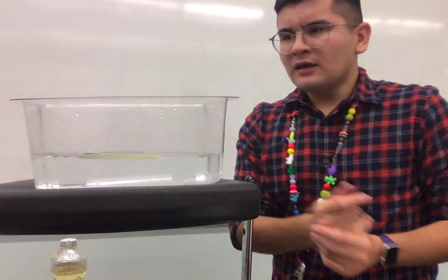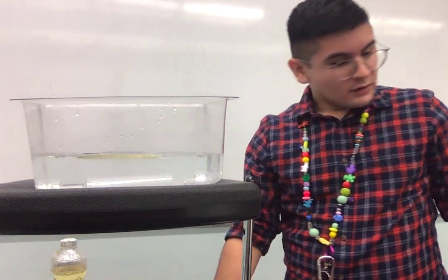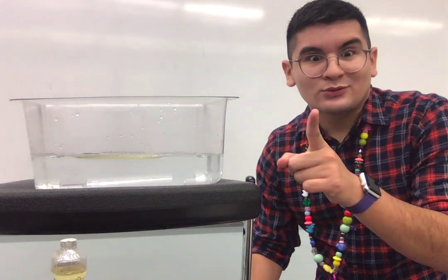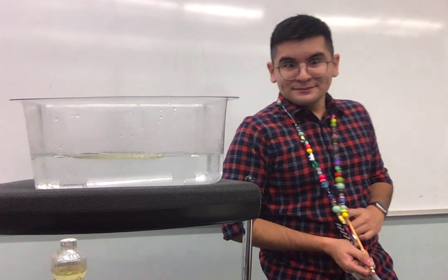And you might be like, Mr. Jimenez, maybe you need to mix it. So let's try it, let's mix it. Let me go get a pencil. I'll be right back. I'm coming. I'm trying to go as fast as I can. Almost there. In 5, in 4, in 3, in 2. Boom. I made it back.